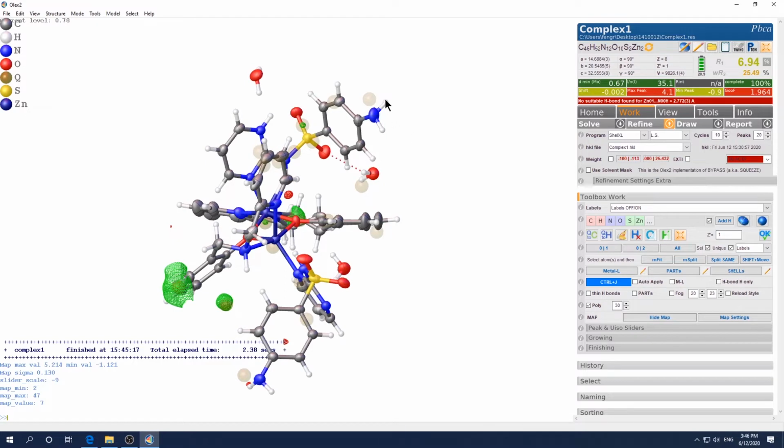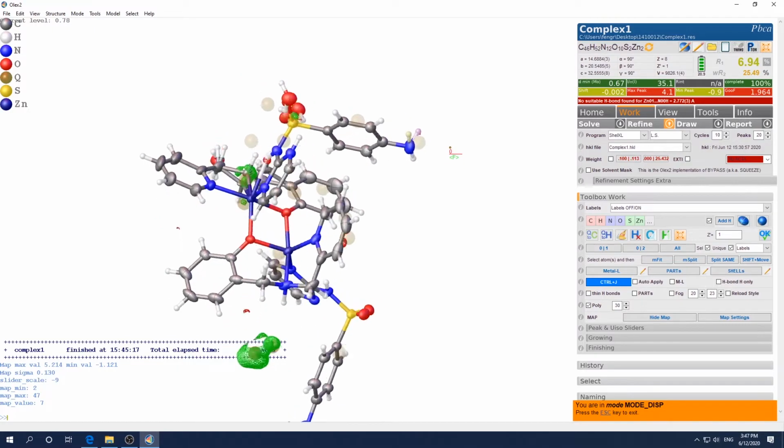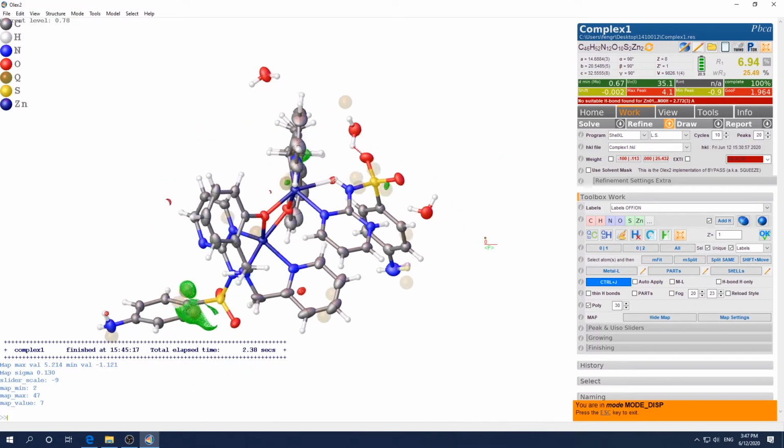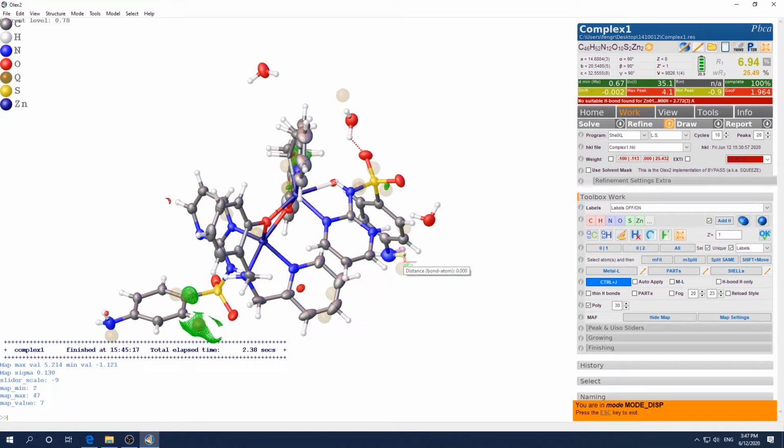So the way to do it is either you just delete this one and name this as a proton, or what I recommend you to do is just choose this type mode fit. Okay, now you will see this special pointer, and you hold shift and click and hold on mouse and drag, and you let go the shift button and the left mouse button, and you just hold and drag the left mouse button to rotate the view and find another better view. Again, hold the shift, press the left mouse button, drag to make sure the overlap. Okay, try your best in this view direction. If it doesn't work, don't worry, you can always change different view direction and repeat this process.